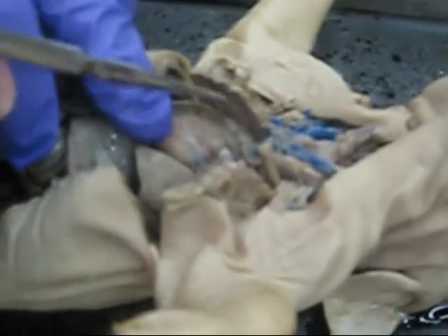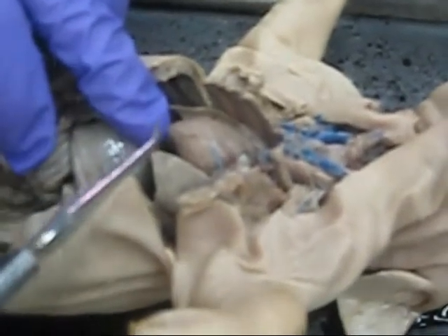All right, can you turn the page? Oh, and the sections of the heart. This is the right auricle, the left auricle, the right ventricle, and the left ventricle. Or the atrium. Atrium works too. All right, thank you, Dexter.